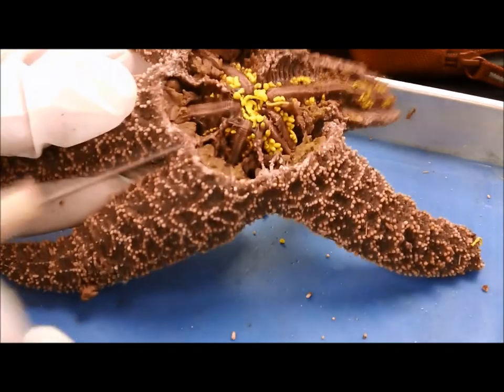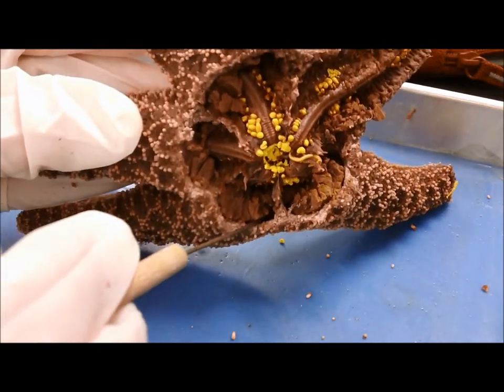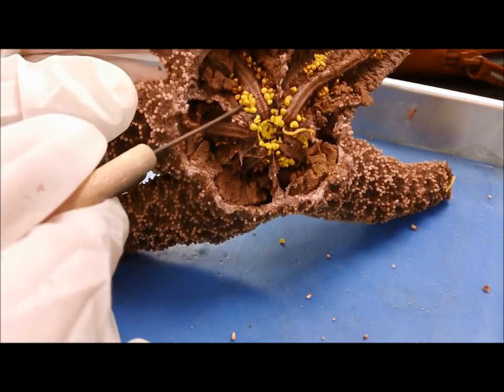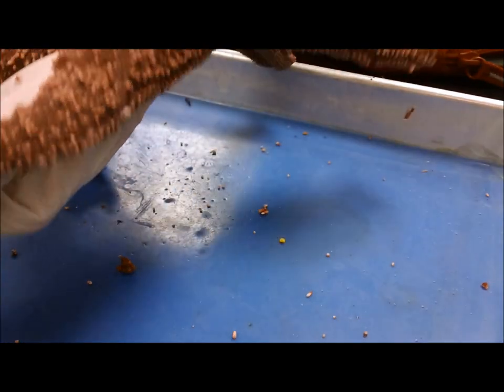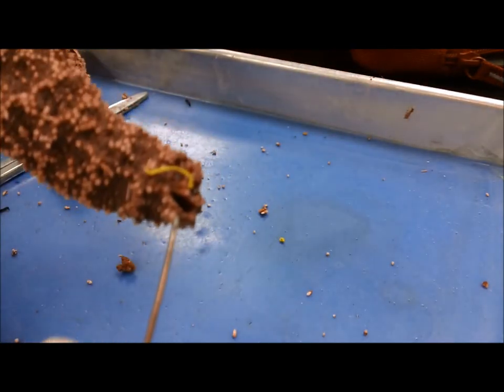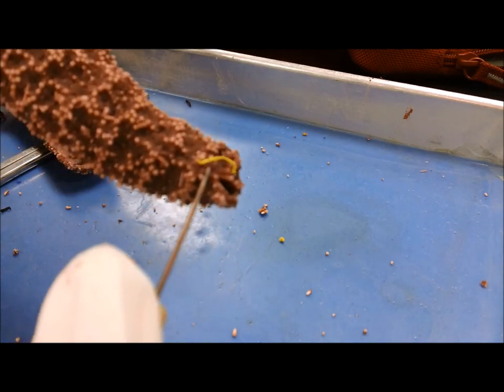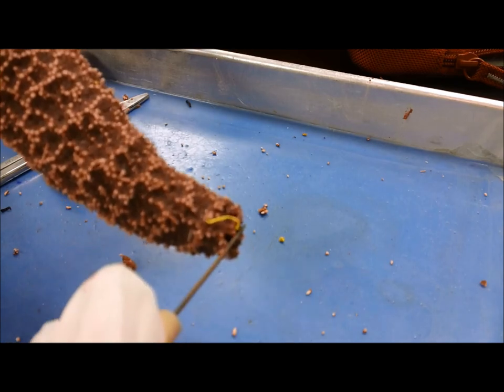If this had been crushed, it would have come out, or they would have been smushed in there. So it doesn't really look like this suffered mechanical harm beyond maybe the tip right here that was already busted. But they heal pretty quickly from things like that — that shouldn't kill thousands of them.